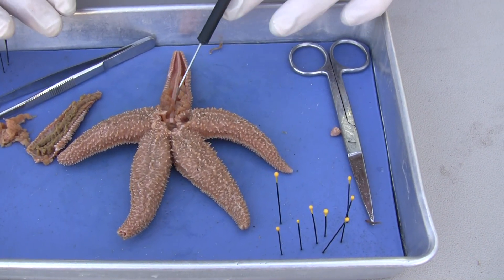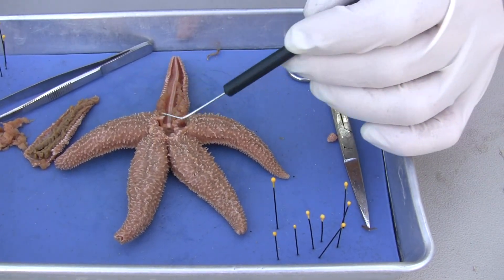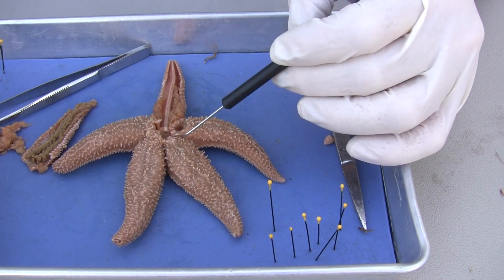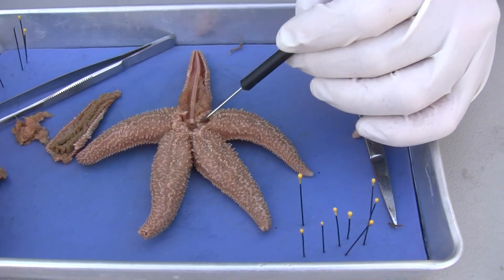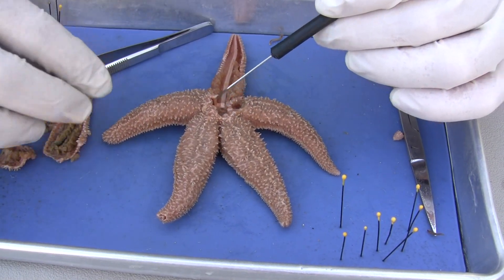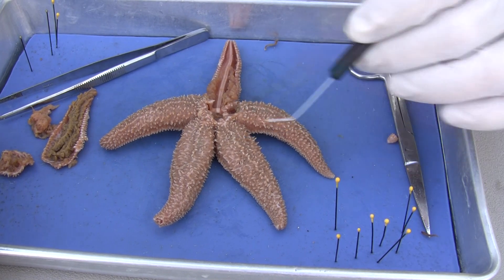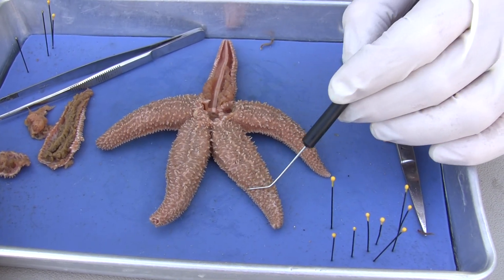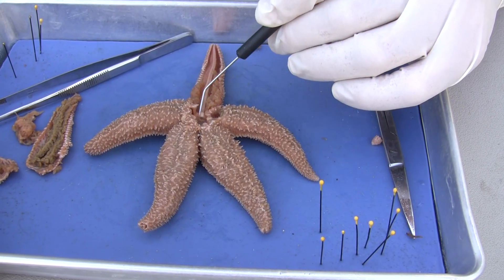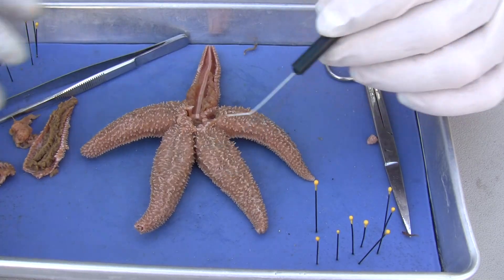Now every ray, remember, is going to have the same thing. It's radially symmetrical. And if this was alive and it was cut in half, as long as you had some of the ring canal, you're not killing the starfish — it could continue to survive and new rays would form. Many years ago, oyster fishermen hated starfish because the starfish in their beds would eat their oysters. Whenever they'd get them, they'd rip them apart thinking they were killing and getting rid of them. But essentially they were just increasing their numbers — because if you have a portion of the ring canal and rays, you can grow a new starfish. So they can reproduce asexually if they're mechanically disassembled.